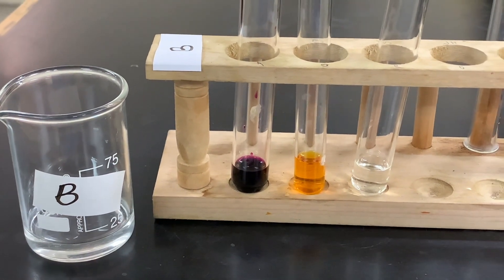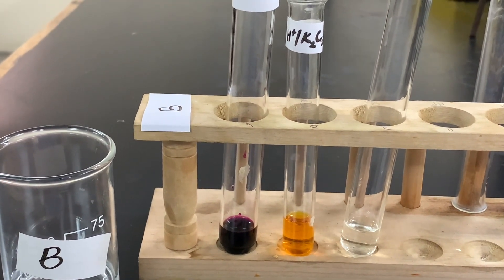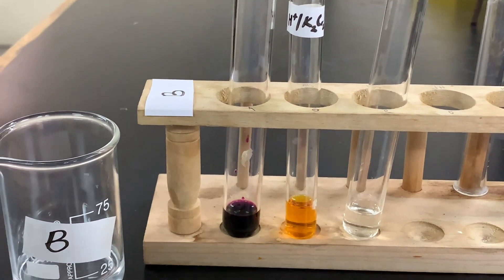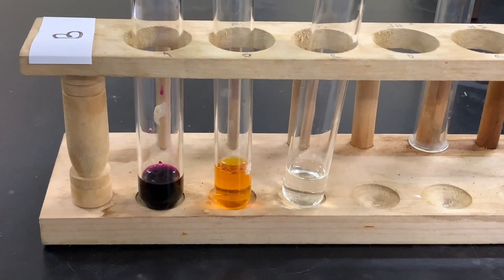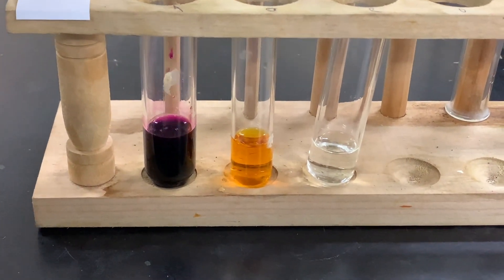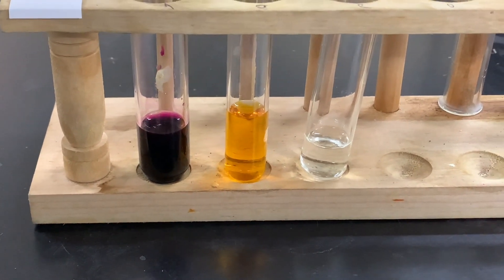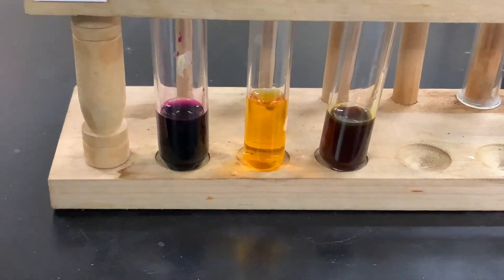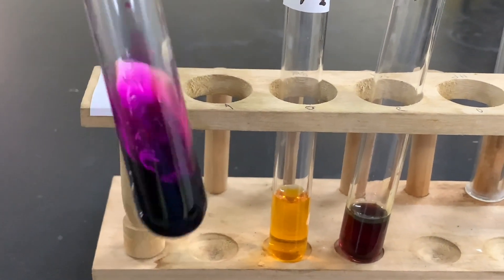Adding a small amount of substance B to, again, acidified potassium manganate 7, acidified potassium dichromate, and acidified potassium iodide. We'll agitate so we get good mixing.